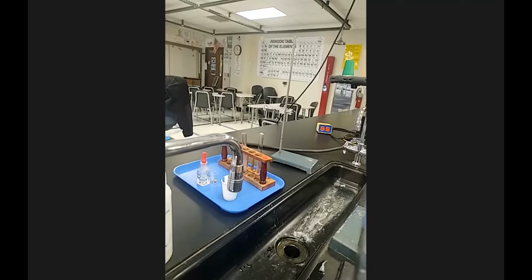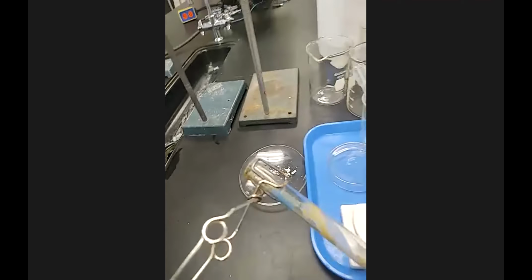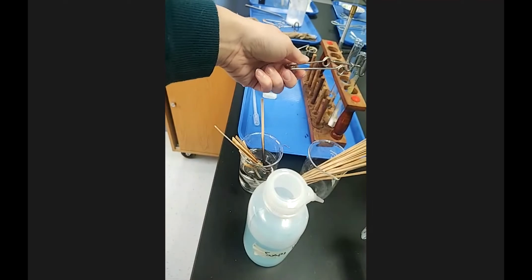Now for cleanup, some good lab techniques for cleaning this up. Get this out of the way. So this test tube is pretty warm. It does say to let it cool down. You can put glass tubes directly on the slate table. It's perfectly fine to let them cool down. You would not want to put them on a plastic rack. I'll let you think about why. Or a plastic tray. A wood rack is okay, so I could let it cool right there.